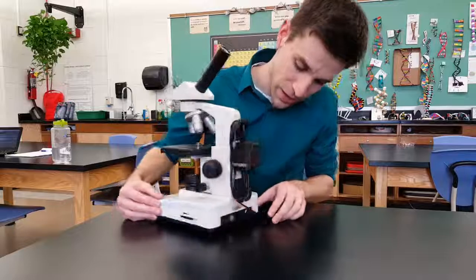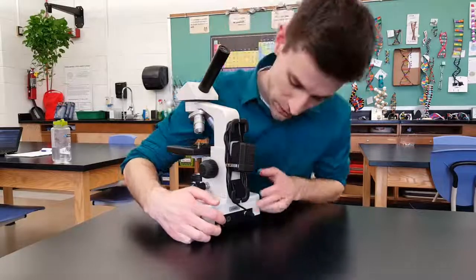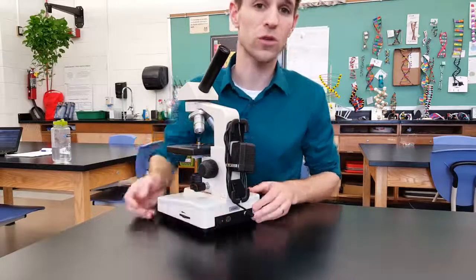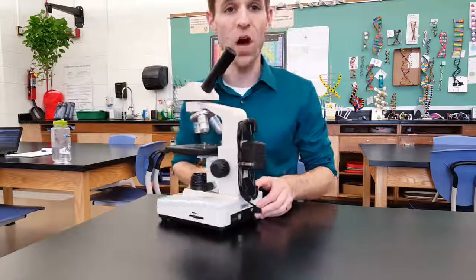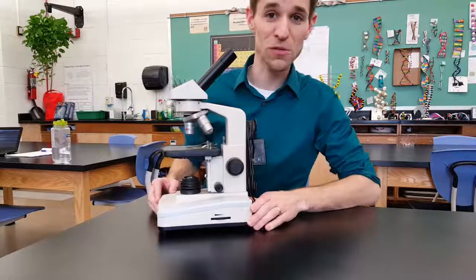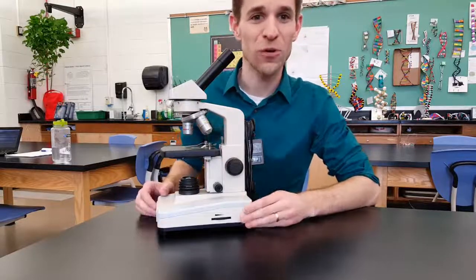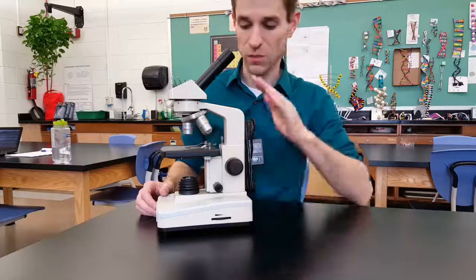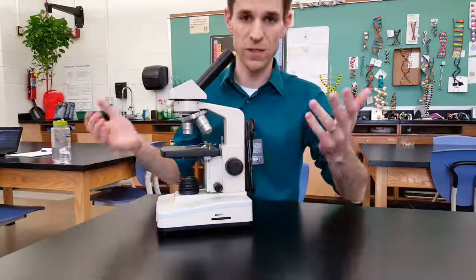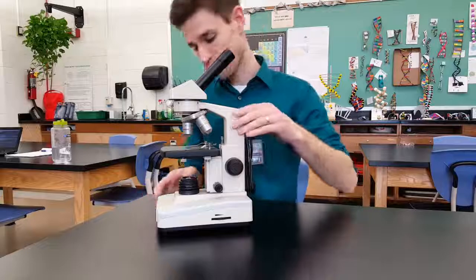On the back is another knob — this is the power knob, right next to where the power cord plugs in, and you can turn your scope on and off. Don't forget to turn your scope on when you want to use it, and definitely don't forget to turn it off when you are done, especially with these rechargeable scopes. If the scope is left on overnight, the battery dies and we can't use it the next day.